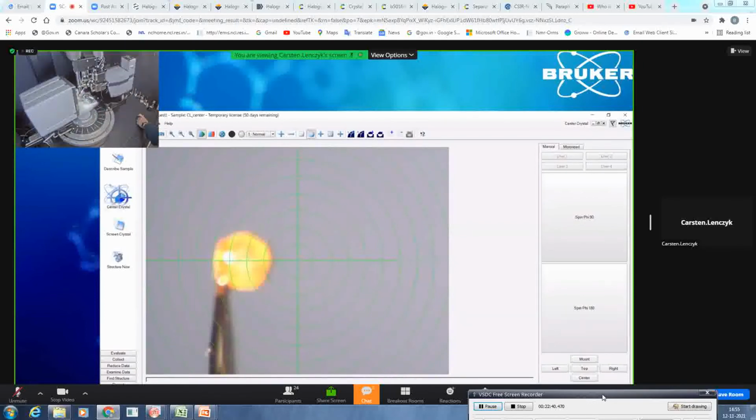Of course, we also have an automated goniometer head, which we call AGH. This is most common in protein work, where they screen a lot of crystals and want to do it fully automatically. But of course, this would also be an option for normal crystallography. As you can see here, you won't have any screws, but this is fully automatic.